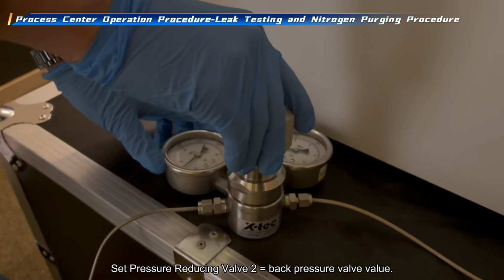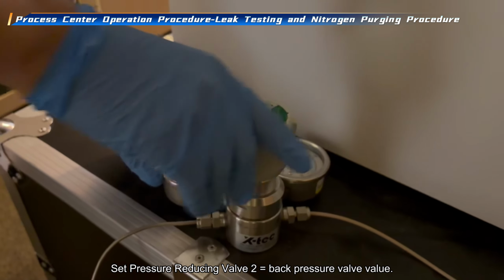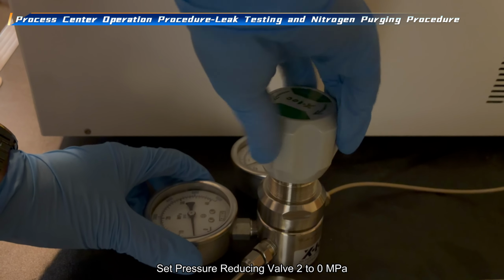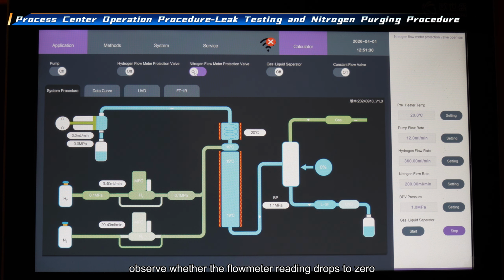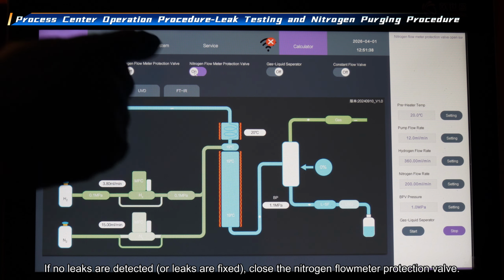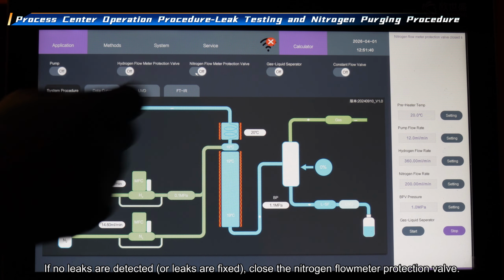Set pressure reducing valve 2 equal to the back pressure valve value. Set pressure reducing valve 2 to 0 megapascal. Observe whether the flow meter reading drops to 0, and use leak detection solution to carefully check both ends of the catalyst column for leaks. If no leaks are detected or leaks are fixed, close the nitrogen flow meter protection valve.